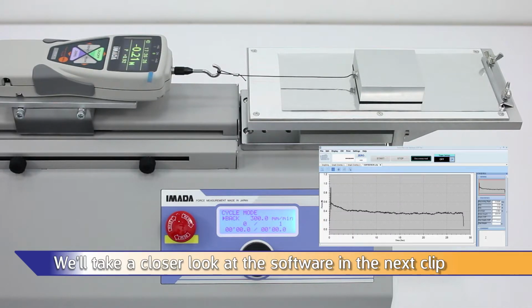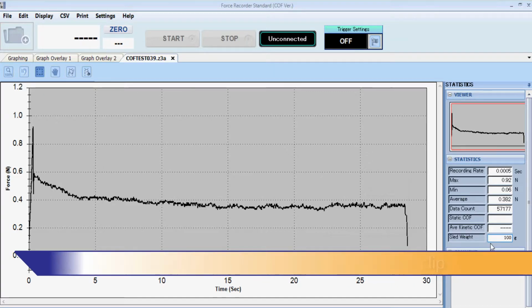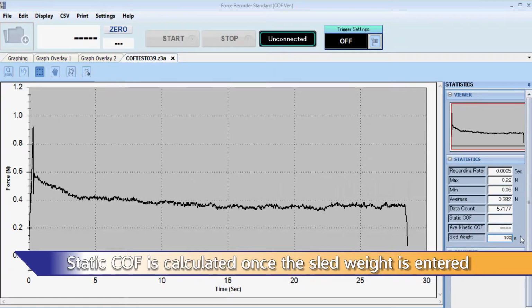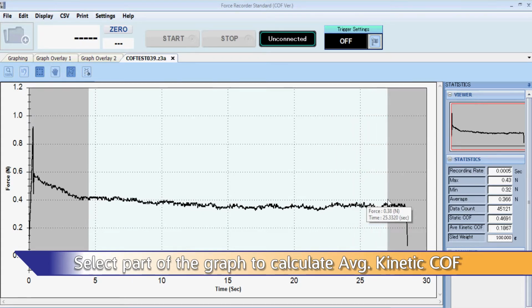We'll take a closer look at the software in the next clip. Static COF is calculated once the sled weight is entered. Select part of the graph to calculate average kinetic COF.